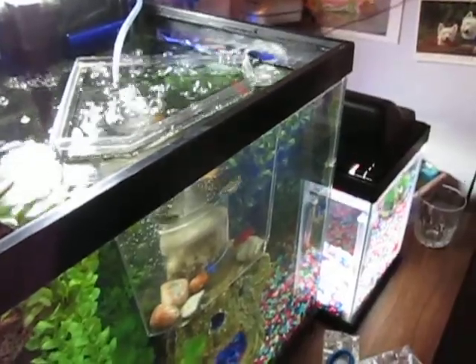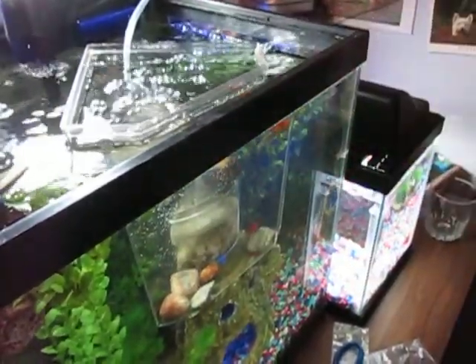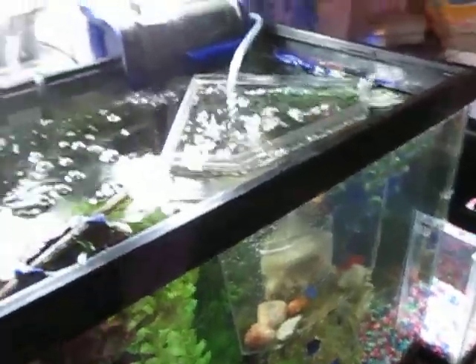Here's my sample. What I'm going to do — because I happen to have a microscope set up, thank you mom — I'm going to put this back over so that they don't jump out.